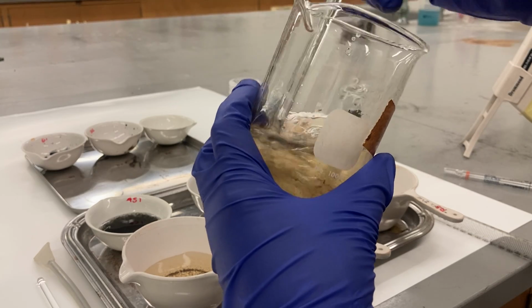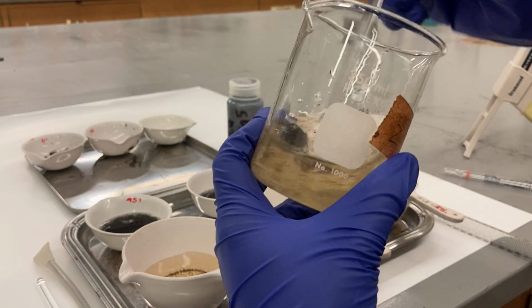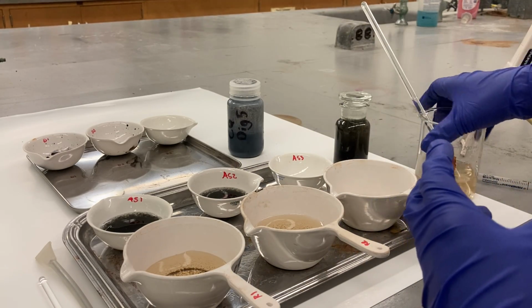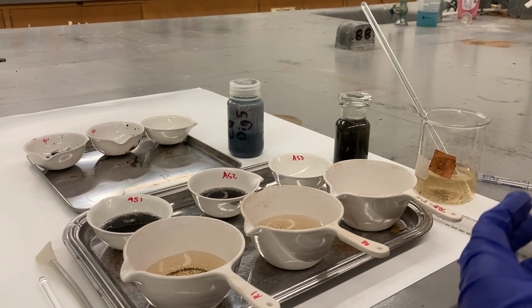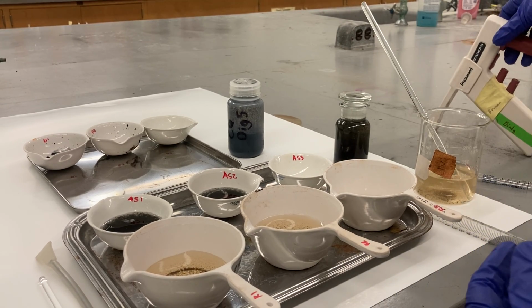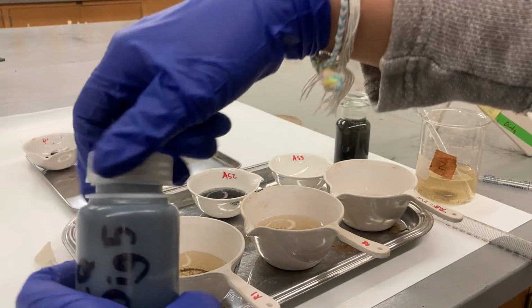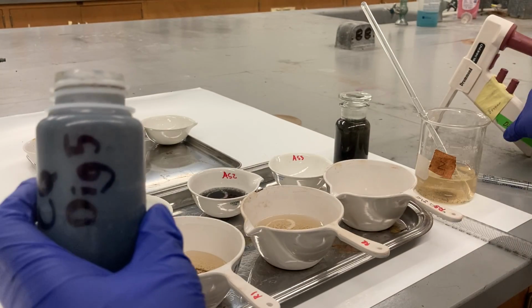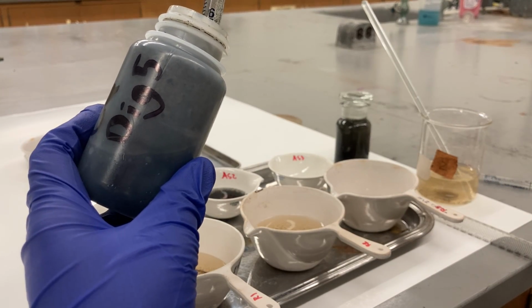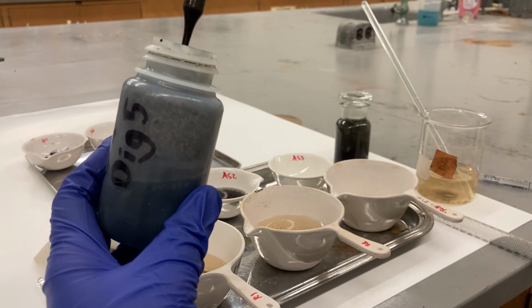Mix it every time before you pipette because you want a homogeneous sample. Okay, mix it. I forgot to change the pipette. You can see this one, I used the digester sample right there. Let's do the digester sample first. Only 5 ml. I mix it. I'm gonna do that one first. I'm sorry. I'm doing it up close so you know how thick it is. I need only 5 ml. There's nothing even coming up because it has a lot of solid in here.